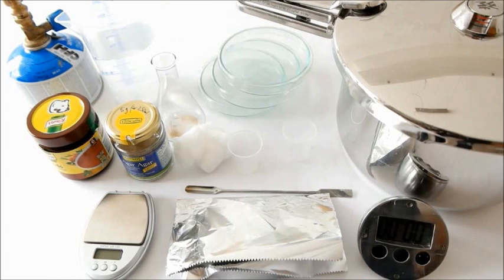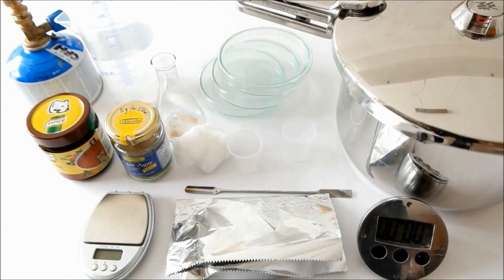In this video I show you a home lab do-it-yourself method to make breeding grounds for bacteria growth in petri dishes.